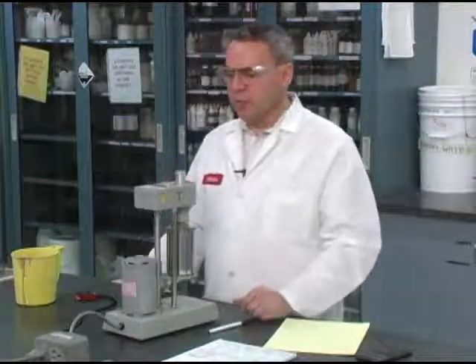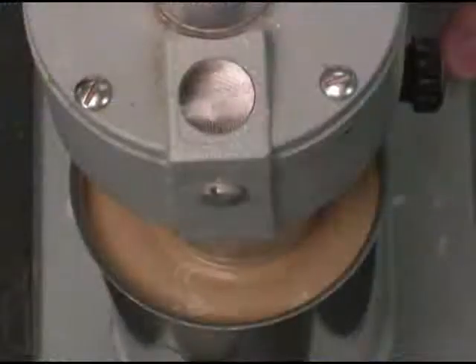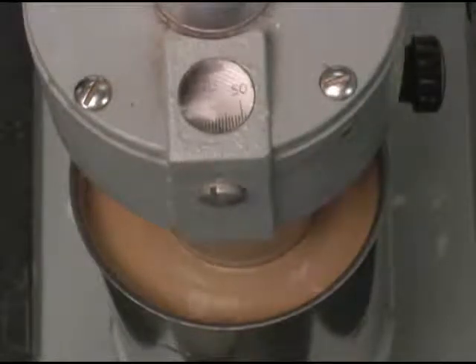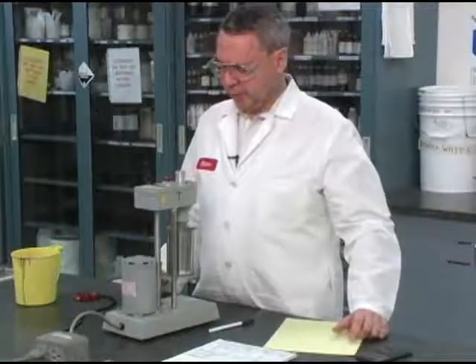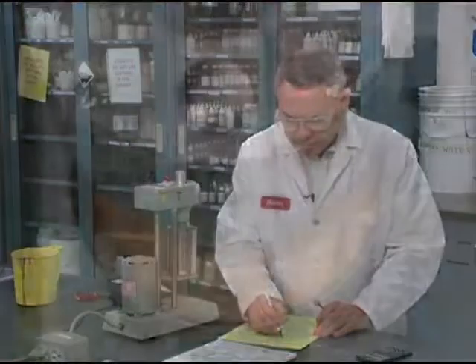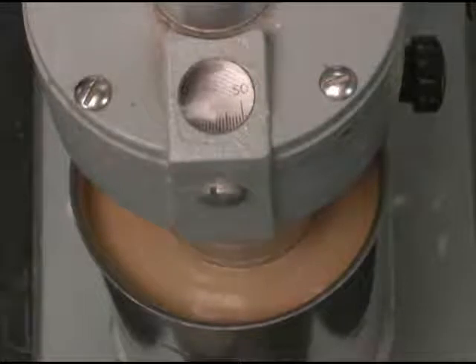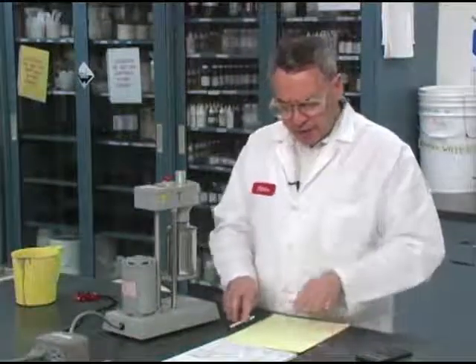Now I'm going to go ahead to the low speed for this particular gear, which is 300 RPM. Wait for the rheology to stabilize. And I can see here that the reading is 43. So these two numbers are enough for me to tell you 82 minus 43 will give us a plastic viscosity of 39, and 43 minus 39 is giving us a yield point of 4. So here I have plastic viscosity, yield point.